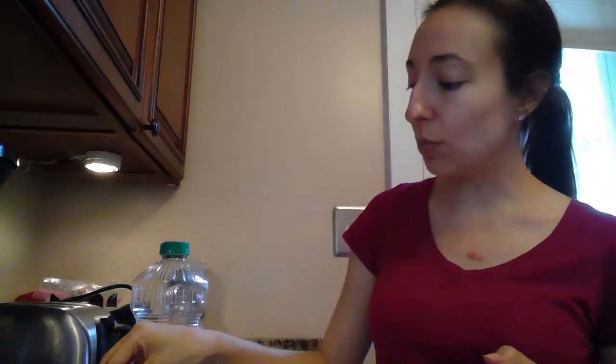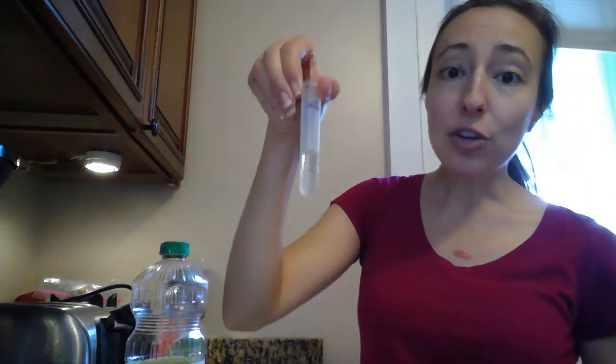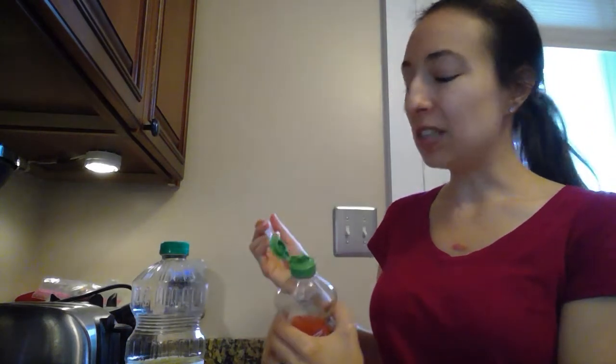Now the first test tube we're going to leave just with water and oil. It says in the second test tube, we set it up the exact same way, but we're actually going to add 5 drops of dish detergent to that test tube. All right, so find test tube number 2, and you're going to add your 5 drops of dish detergent. So you can, if you have a dropper on yours, squeeze it out that way, but mine's going to run out a little bit too quickly, so I recommend using the pipette.